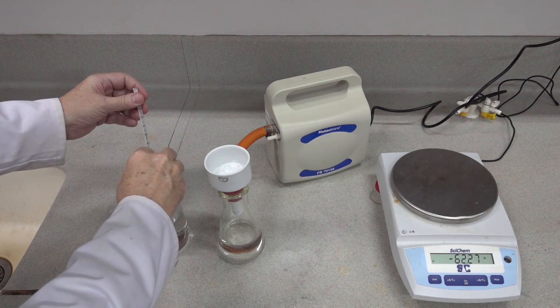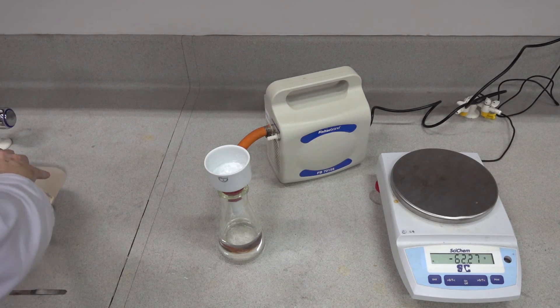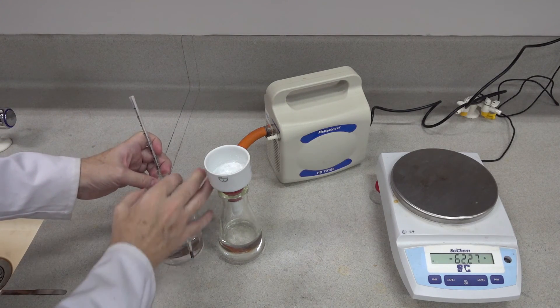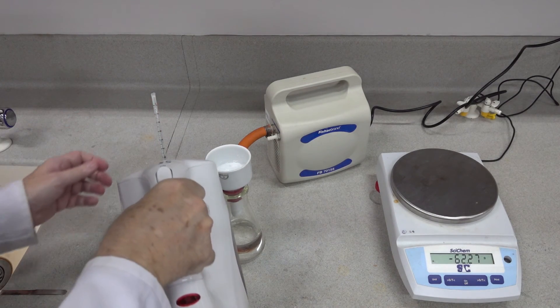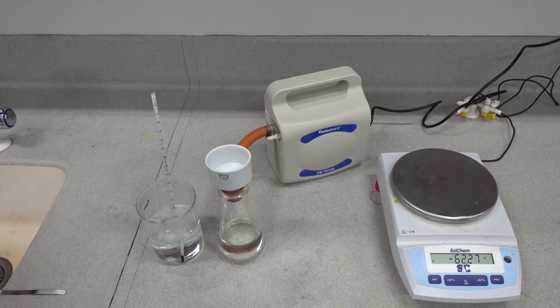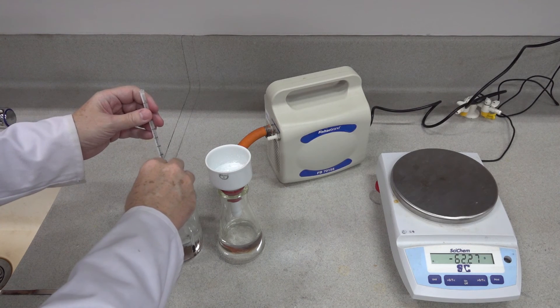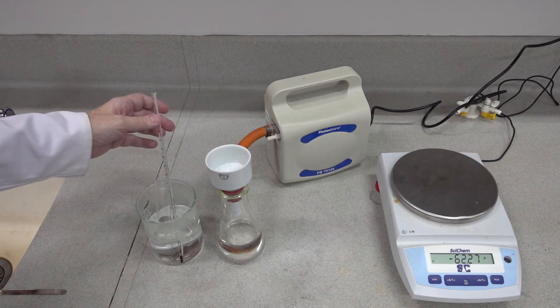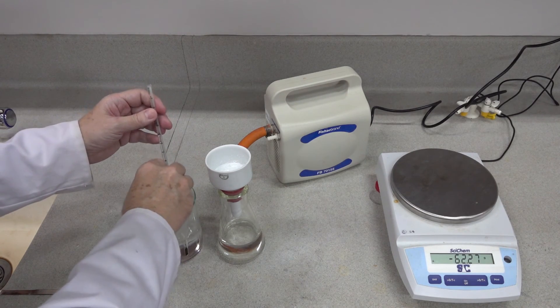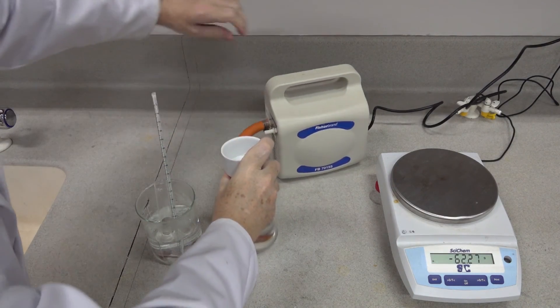We're just trying to get the product to dissolve. I'm going to remove a little of the water and add some more hot water. We're coming up to 73 degrees now. You could stir with a glass rod here — it's almost all dissolved. Just waiting for the heat to transfer to the hot solvent.